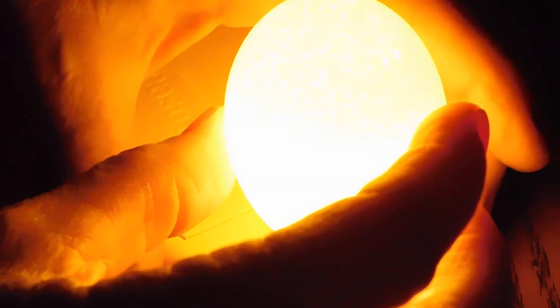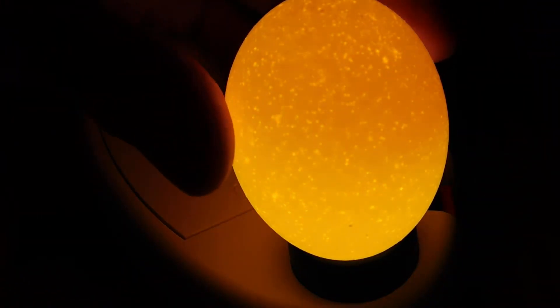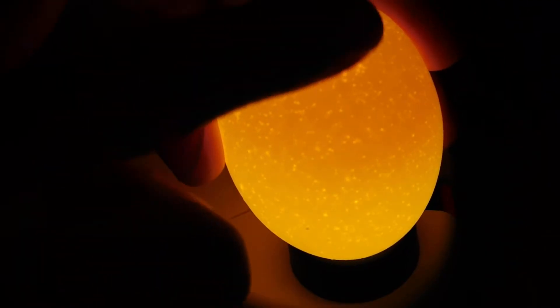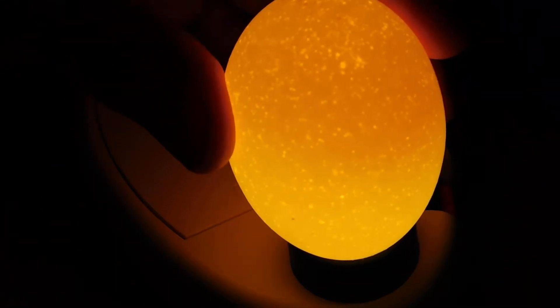First I'm going to show you what an unincubated egg looks like. This is what our eggs started out looking like. As you can see, all you can really see is kind of a yellow yolk in there. Not much else.